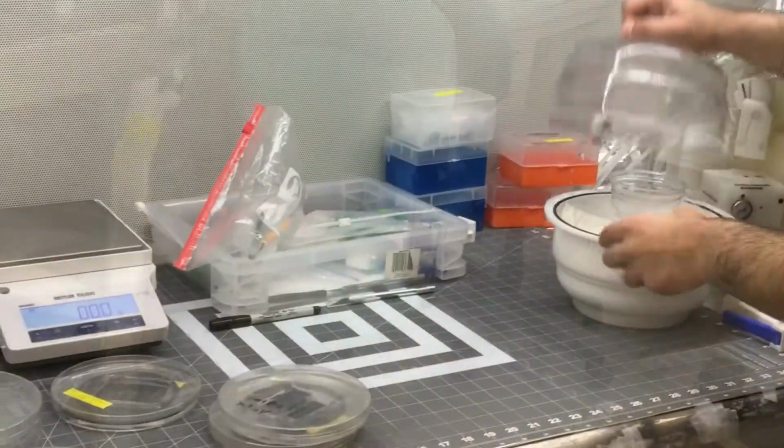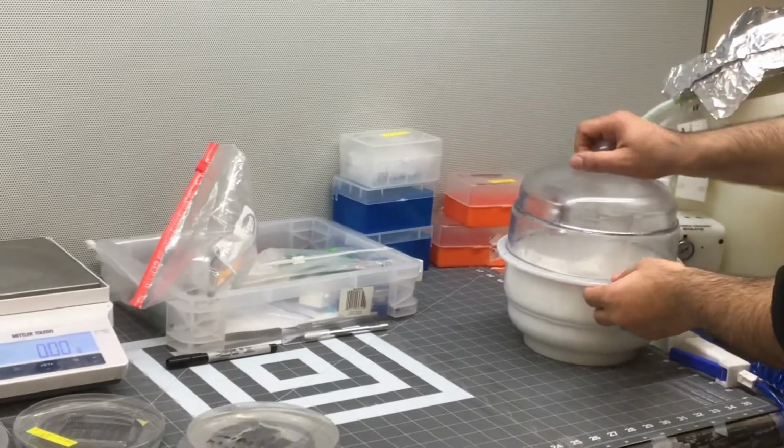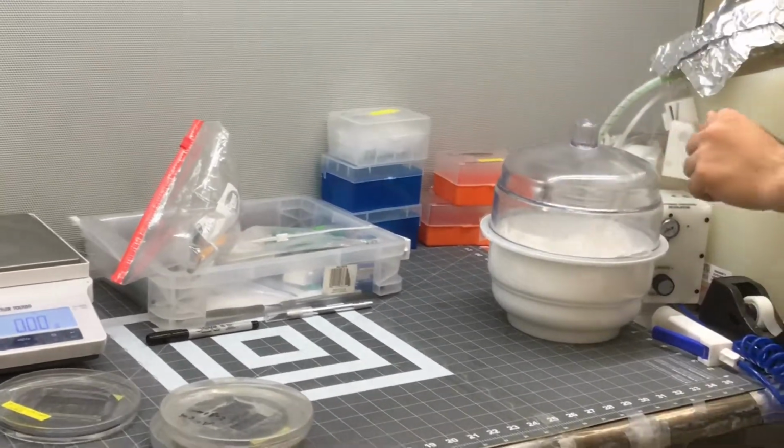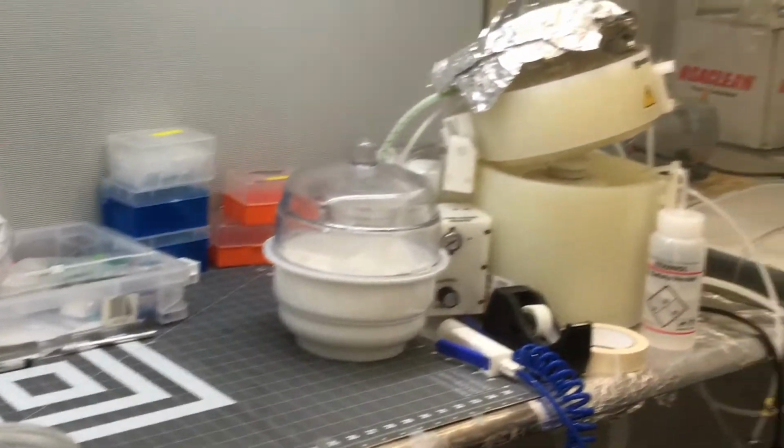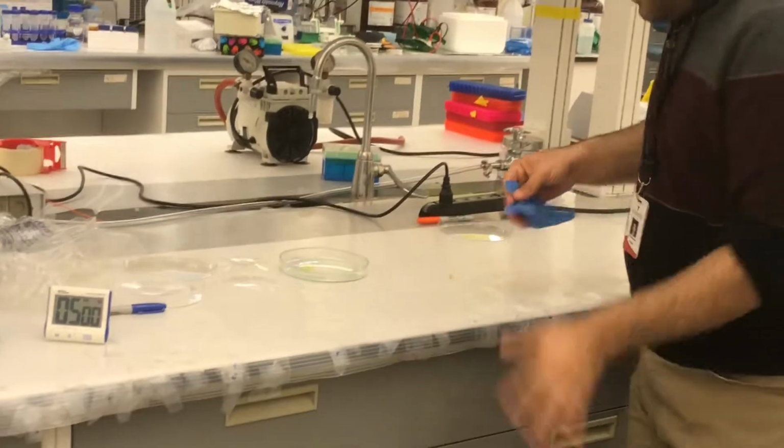No, Ali, this happens. So you just check now? No. It's done. Just 1 second. I wear gloves. Next student, do not do it without gloves.